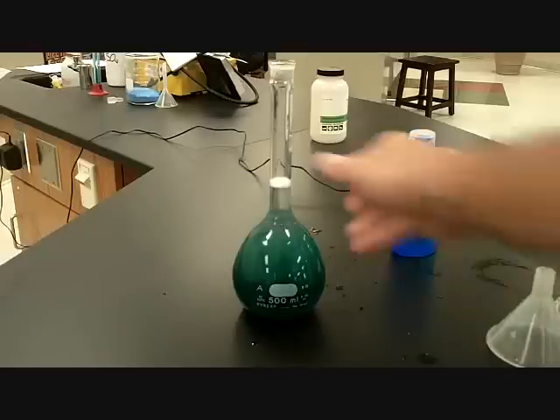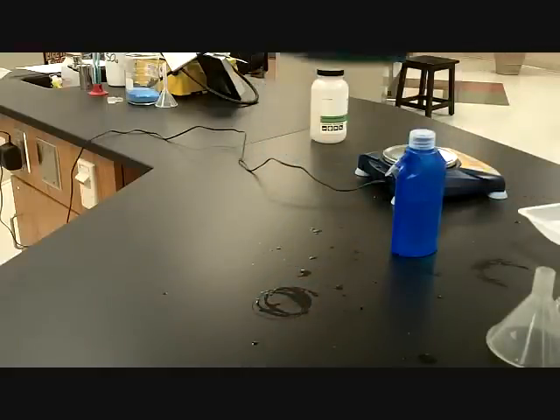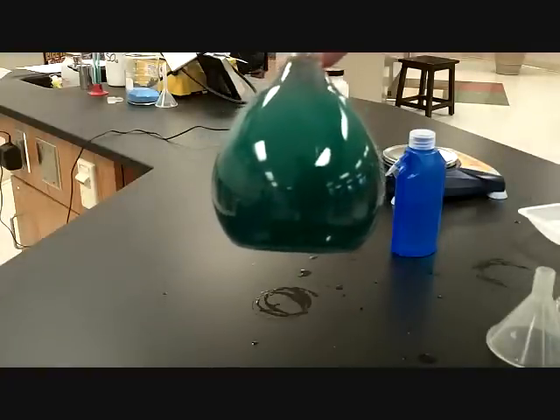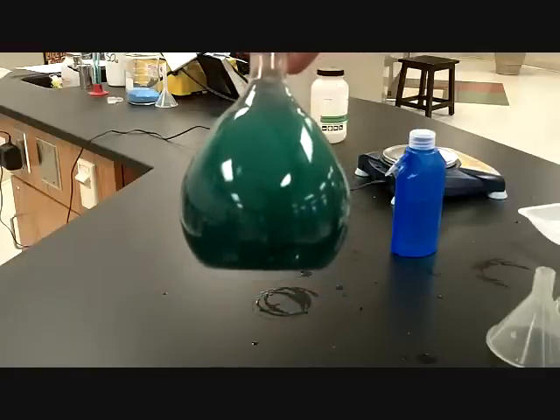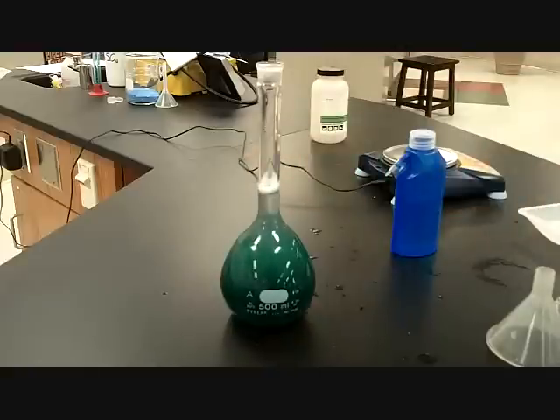Okay. Now, when I look at this, would you say that's a dark green color, kind of more at the bottom than it is at the top? Would you say that's dark green? Yes? They can't see you nod your head, so yes or no? Yes. Okay. So now what we're going to do is, this is our stock solution. So we have a 1.5 molar solution of nickel(II) chloride. Now I want us to do something with this.